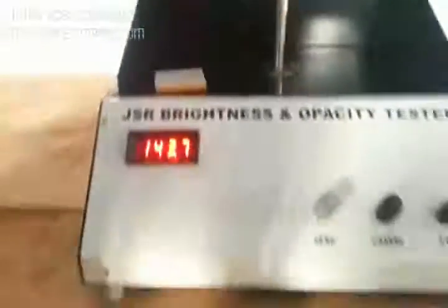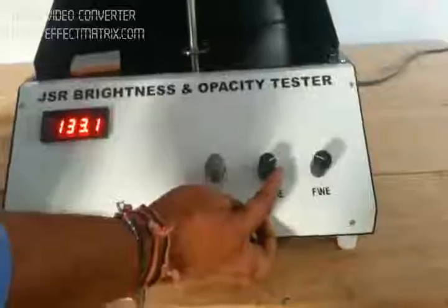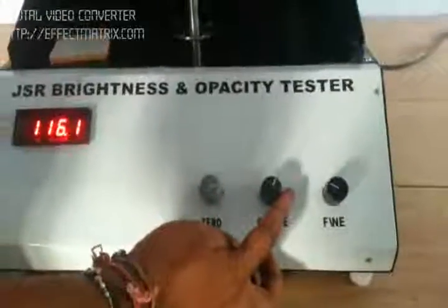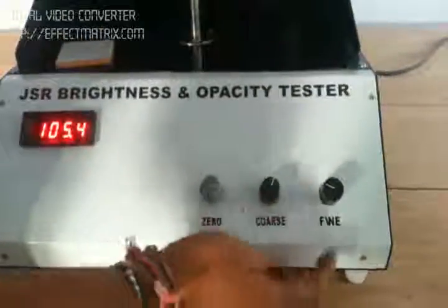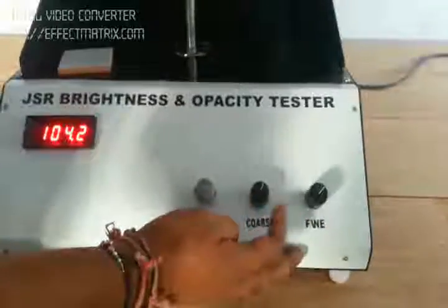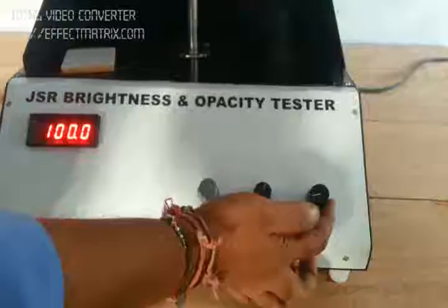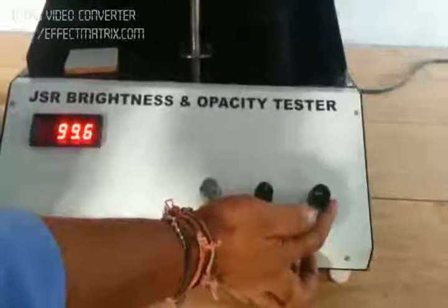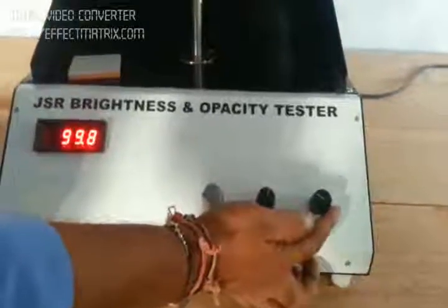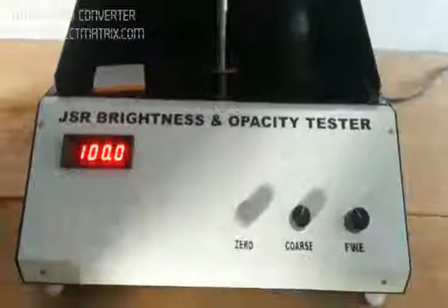We make a multi-fold of the paper whose opacity we want to measure, and place it over the black cavity like this. Then we set the reading to 100 using the coarse pot first, very slowly, and then the fine pot for a finely adjusted result. This is now 100 percent opacity.